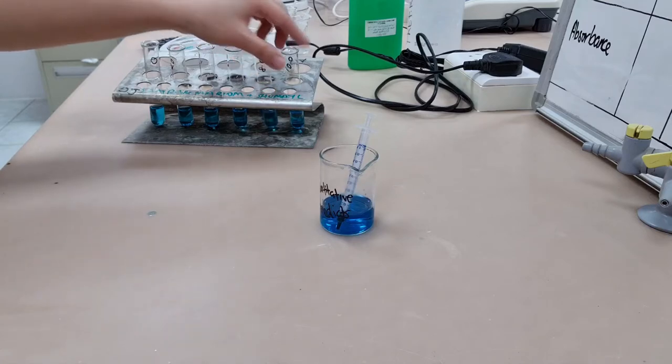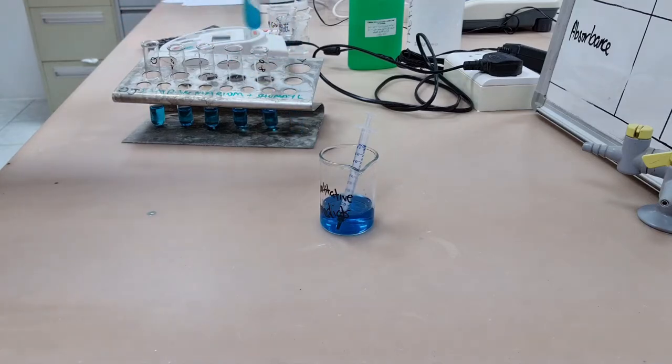Giving the solution and the Benedict's reagent a shake is very much part of the procedure. Ensure to write this when you're describing the experiment in an exam.